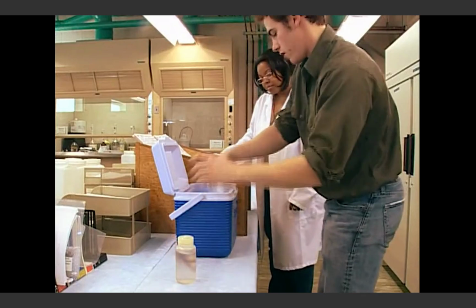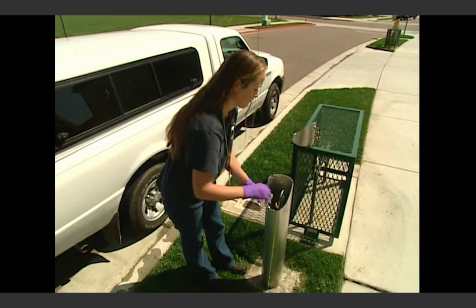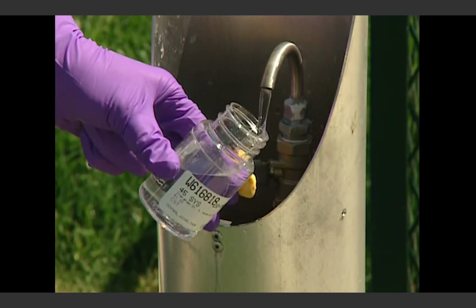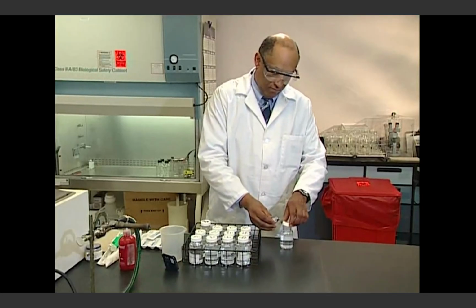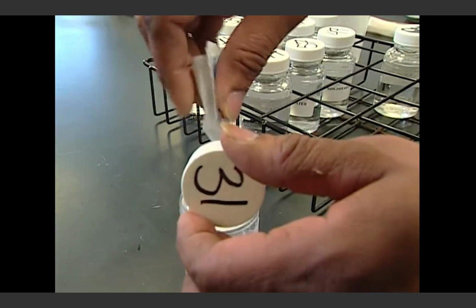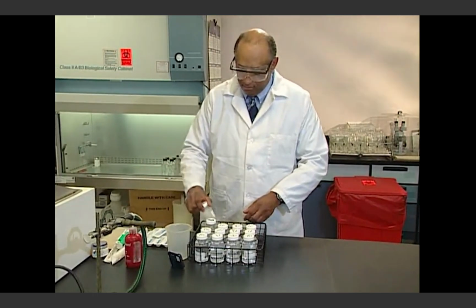Even though effective water treatment procedures may be carefully practiced, it is still important to regularly check the final finished product within the distribution system. And the only way to accomplish that is through reliable and representative system sampling conducted, tested, and retested on an ongoing basis. Here are 3 points to always remember.